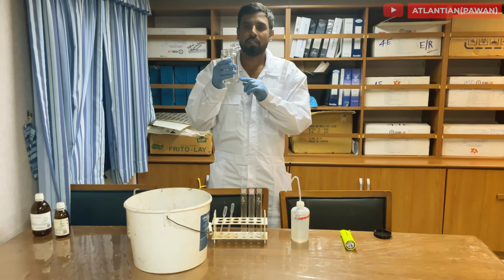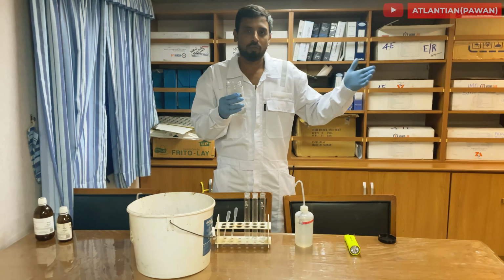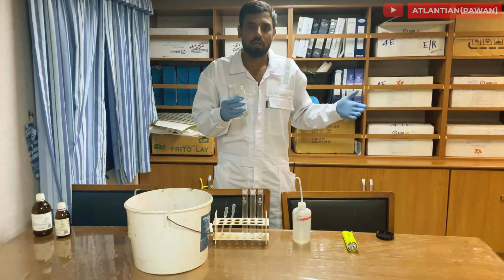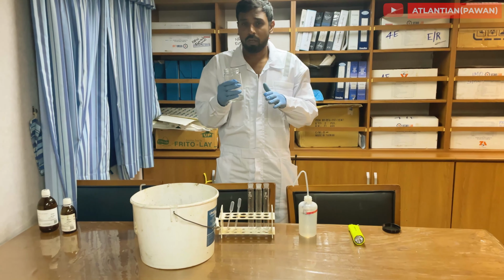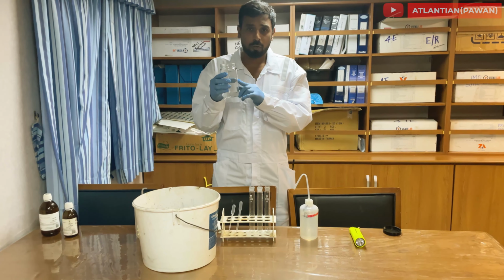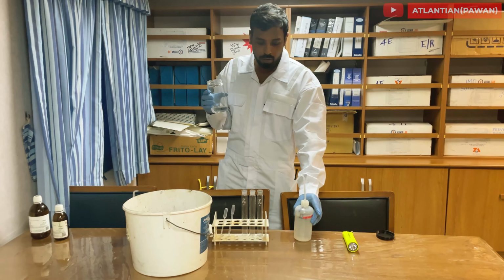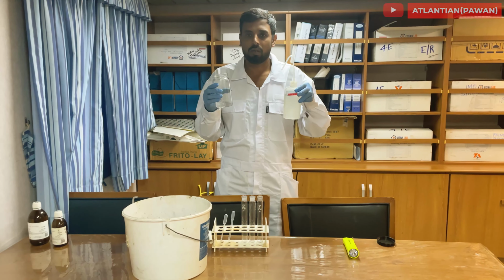So now there are many ways in which we can do this test, because it depends upon the stringentness of the port at which we are going to perform this wall wash. The most stringent one which is preferred is the 50:50 ratio. That means 50% of your tank methanol and 50% of your DI water. So this is considered the most stringent one.